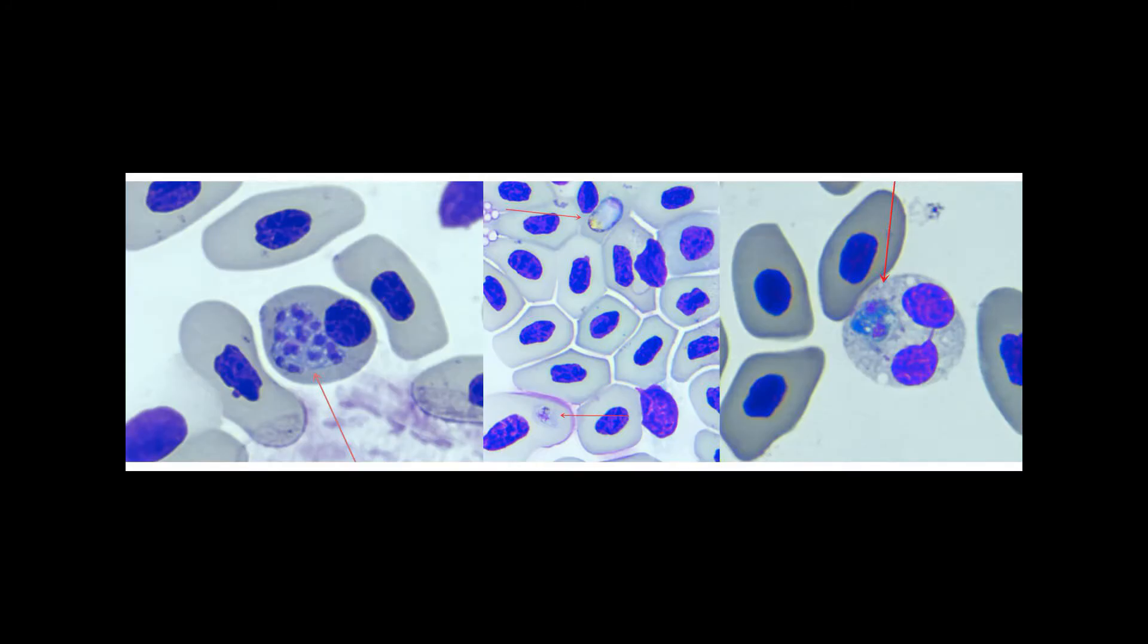This video will teach you how to stain a blood smear on a glass slide for microscopy, rendering blood components like red and white blood cells, as well as bacteria and parasites, dark enough to be analyzed.